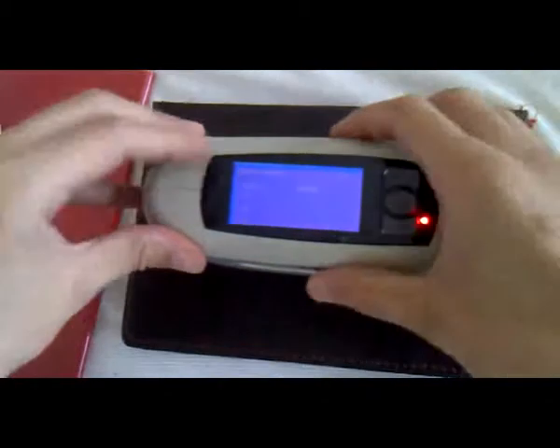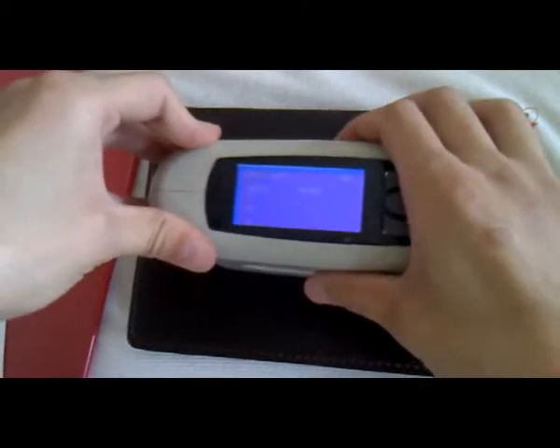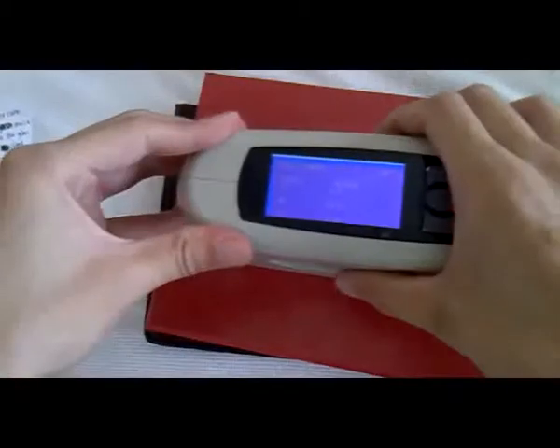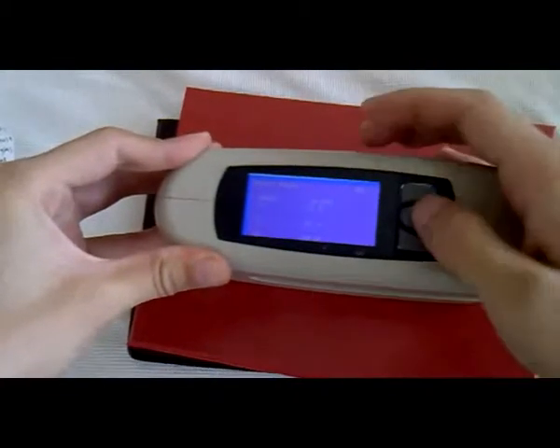For example, it's very easy. Press the test key — now the value is shown. Test again. OK.